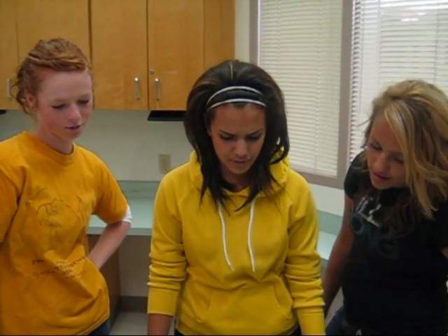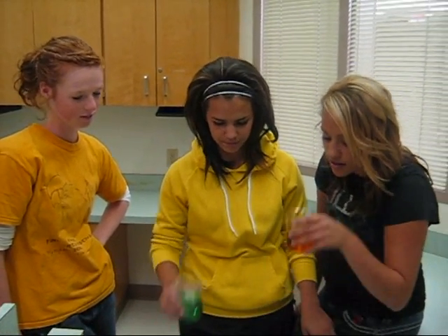What did we do next, guys? Why are you talking like that? I'm so sick today. My nose is really stuffed up. That sucks. So, back to the assignment. It says you're supposed to waft the fumes. I don't know what that means. Me either. You should probably just smell it.